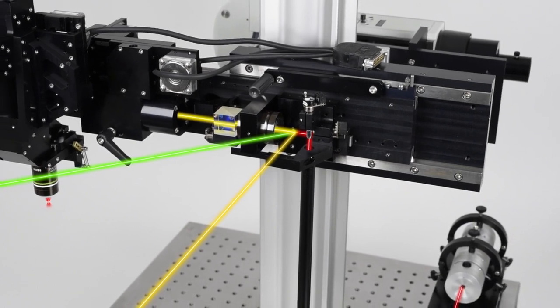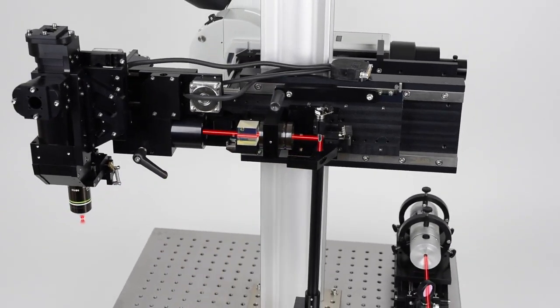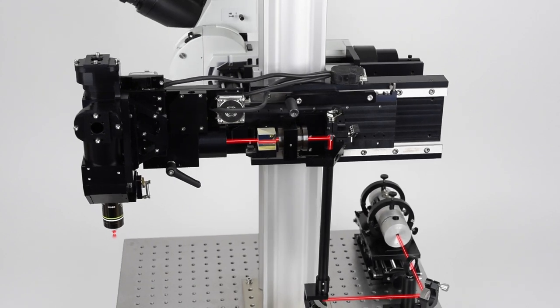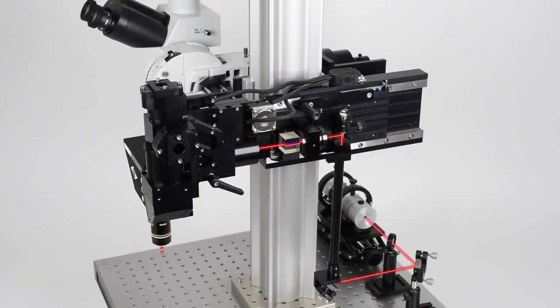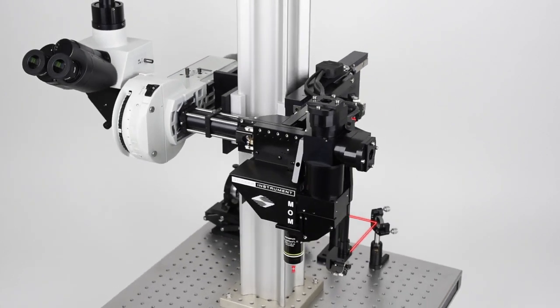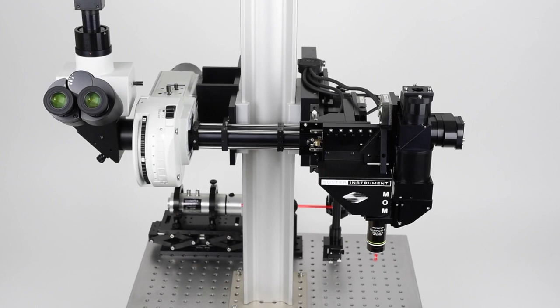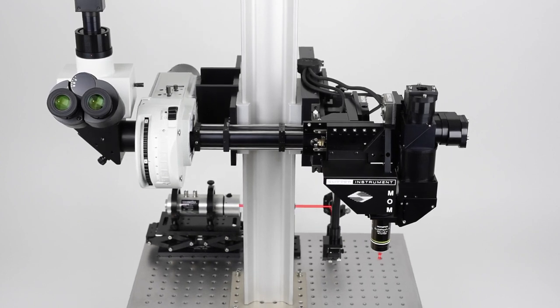Designed for flexibility, the movable objective microscope is easily modified. Will you need to stimulate many cells? Will you discover that you need to image deeper with 3-photon imaging? Or will you develop and test a novel optical technique that has never been tried before? The many flexible beam path options on the Sutter Instrument Movable Objective Microscope make it the best open platform multi-photon system to provide such downstream flexibility to match your dynamic research needs.